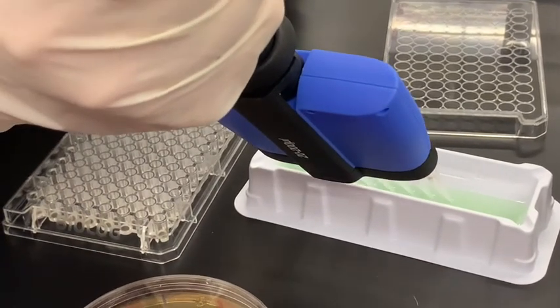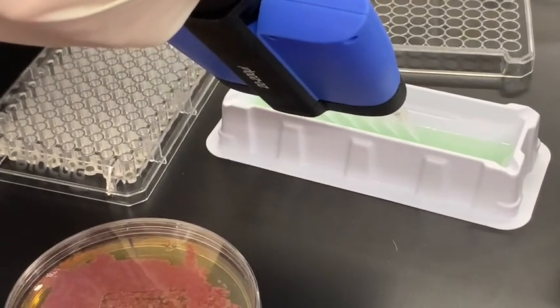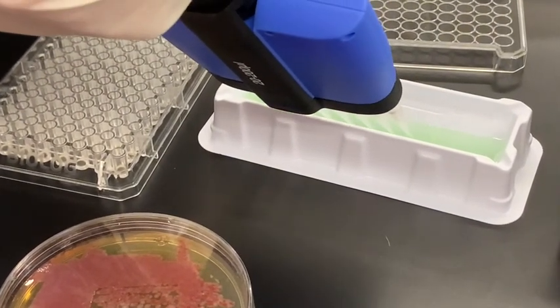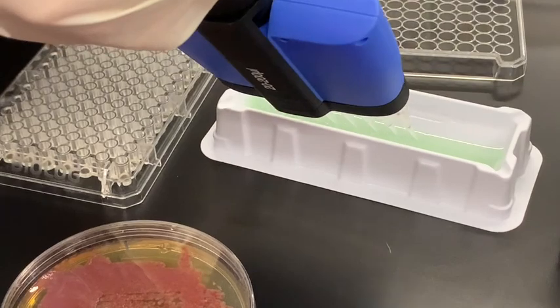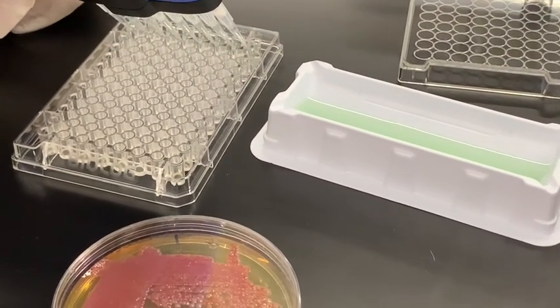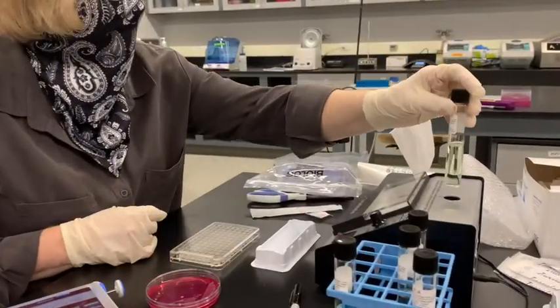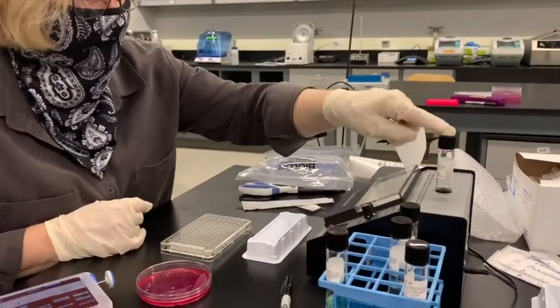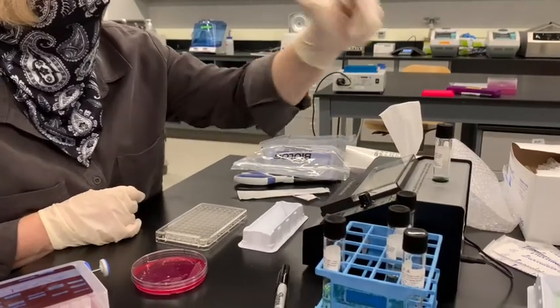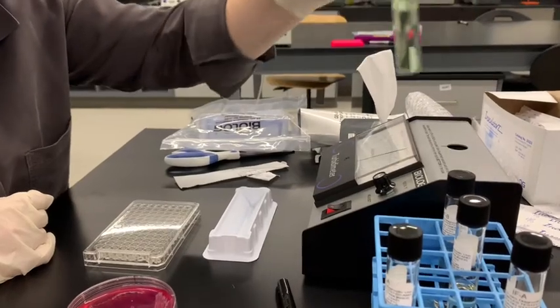All right, so that's a little bit, there's some bubbles in there, so I'm going to pick that up again. Some bubbles again, but it's okay. So I'm zeroing it. This is with a different tube. This is the one I just put in. I'm zeroing it to 100.